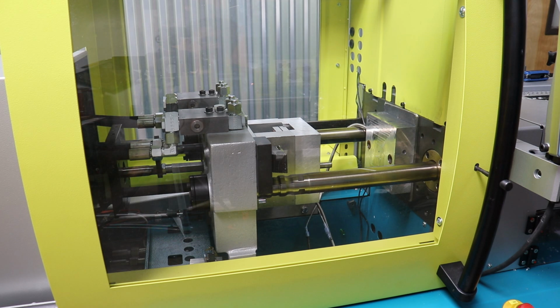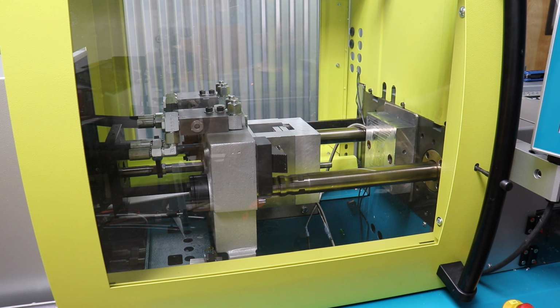All right, so I think we've got the mold pretty well set up. So I am going to load plastic and get the heaters going and continue to heat up the system oil. That's the motor sound you heard intermittently. So we'll turn it back on and I'll get some plastic and load her up.